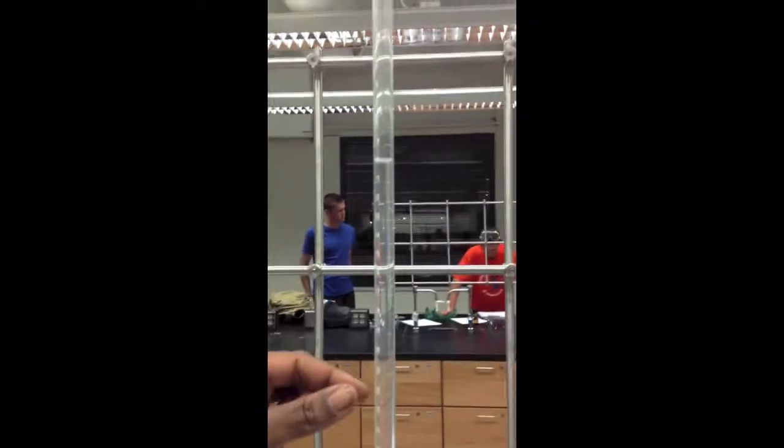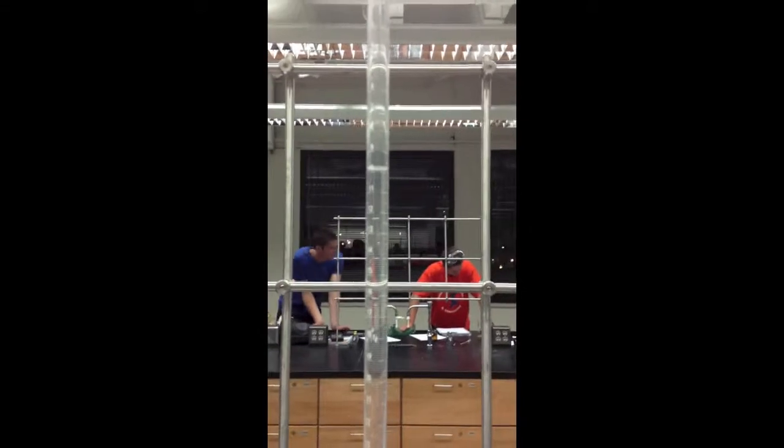Hello, my name is Angela Bird, and today we're going to talk about titrations. Titrations are performed to determine the concentration of a solution. Before we started today, we cleared out our burette, we primed it 3 times with the NaOH solution. Then we filled it up to 10 milliliters of NaOH solution.